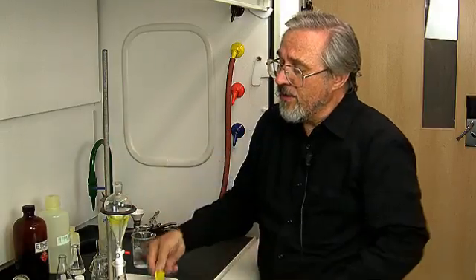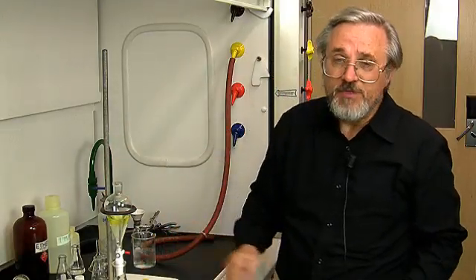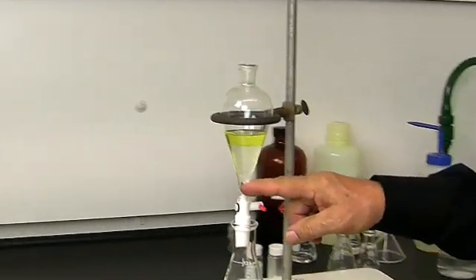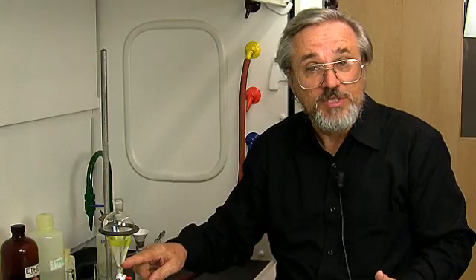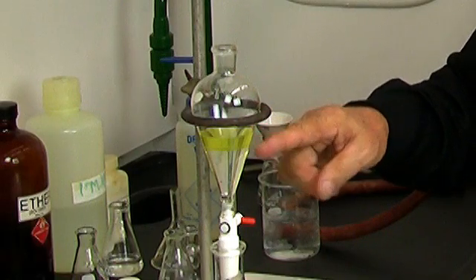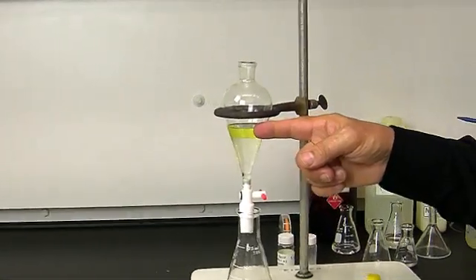All right. That's the first step. Presumably, we've made a separation. We now have sodium benzoate in the aqueous layer, which is a lower layer because it's more dense, and the fluorenone, which has not reacted with the sodium hydroxide has stayed in the upper diethyl ether layer.